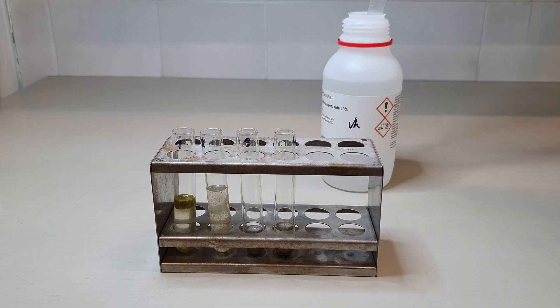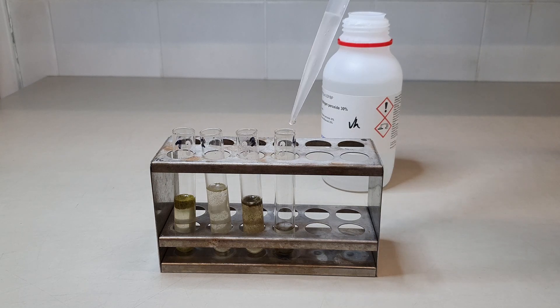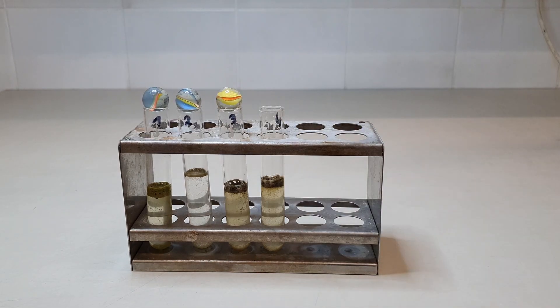In the next step, we use hydrogen peroxide as a strong oxidizing agent to remove all organic content from the diatom cells. For this purpose, pipette at least 3 ml of hydrogen peroxide into each glass tube. Since the reaction starts immediately, the glass tubes are covered with glass beads to avoid spilling of material.